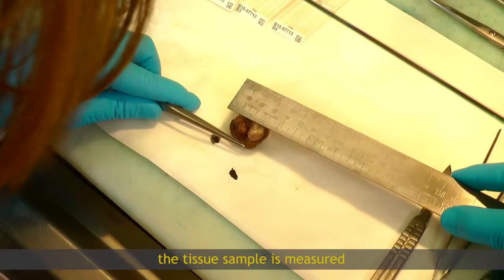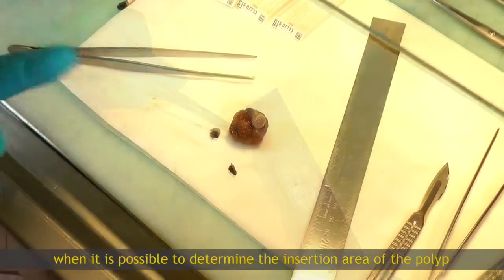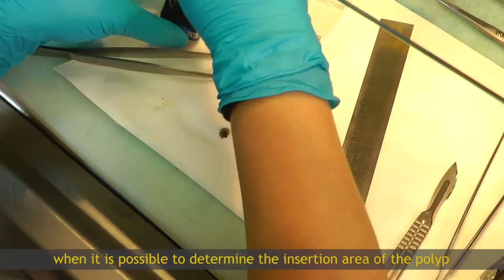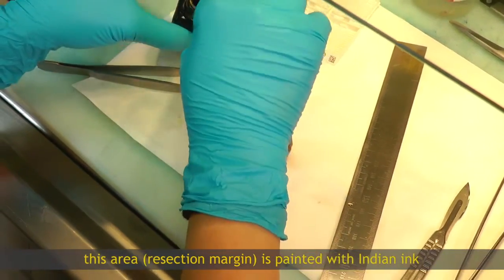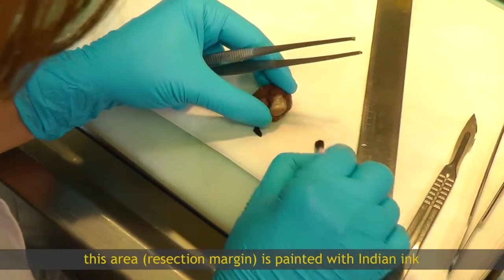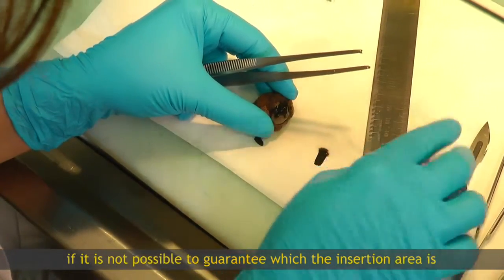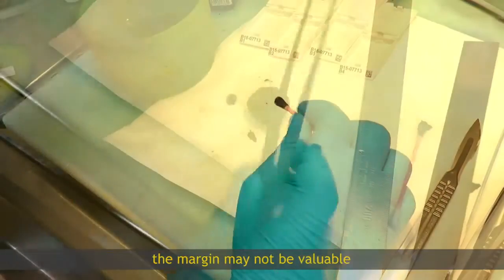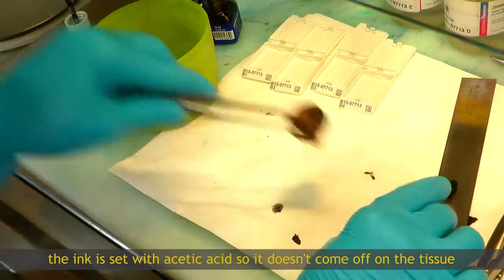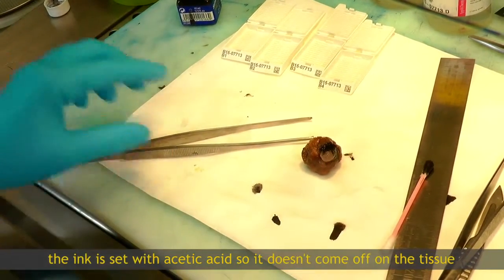The tissue sample is measured. When it is possible to determine the insertion area of the polyp, this area — the resection margin — is painted with Indian ink. If it is not possible to guarantee which the insertion area is, the margin may not be valuable. The ink is set with acetic acid so it does not come off on the tissue.